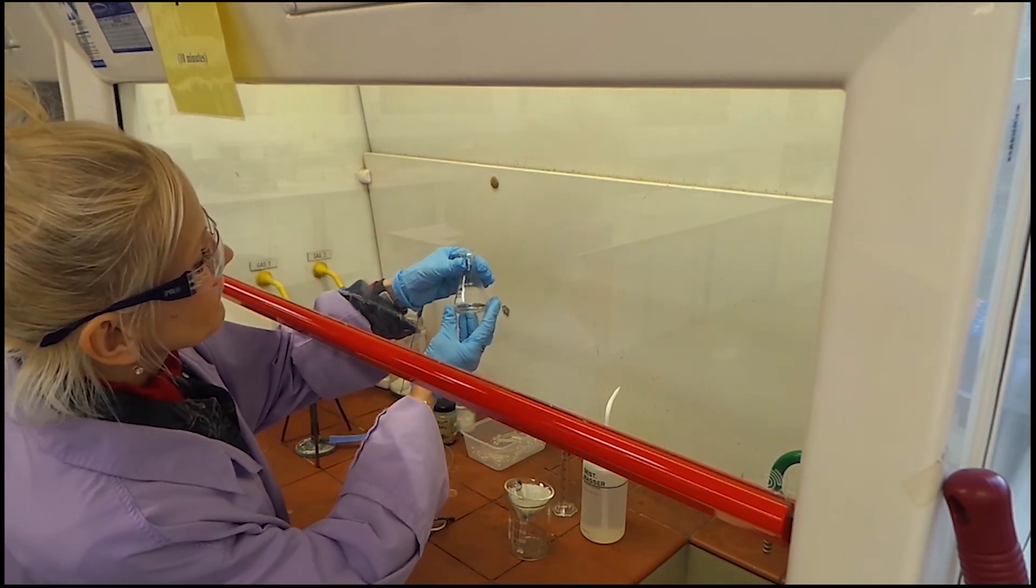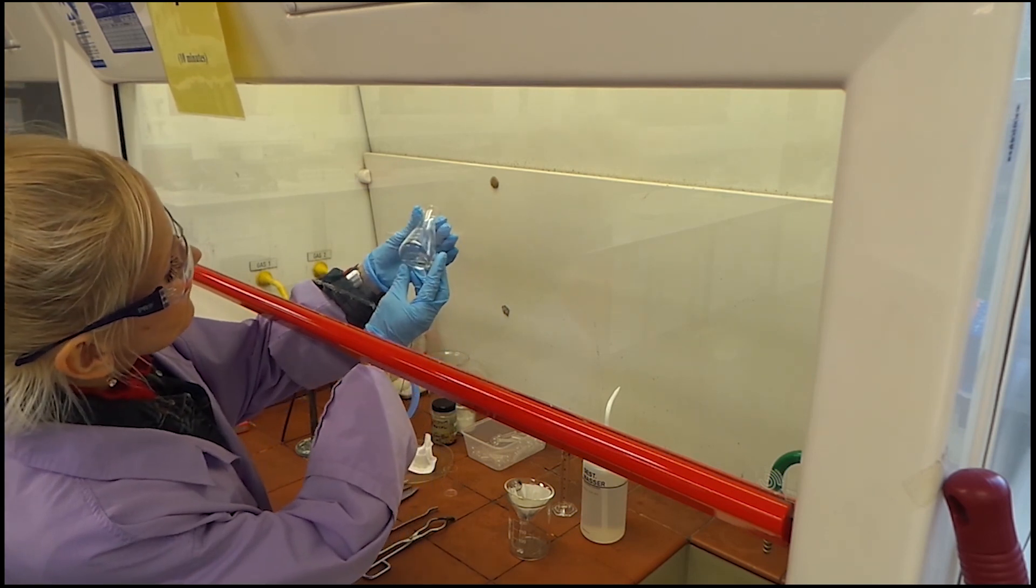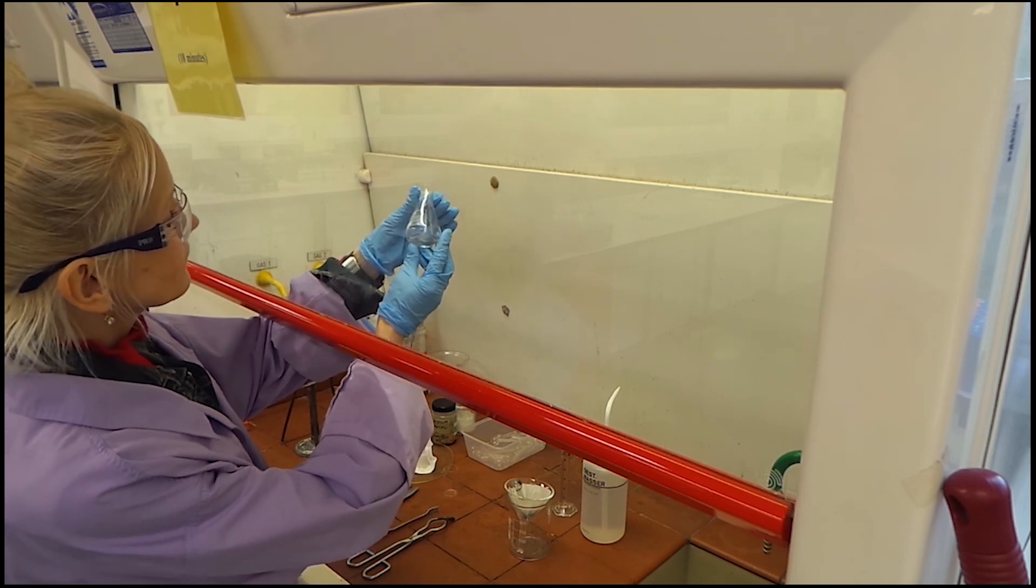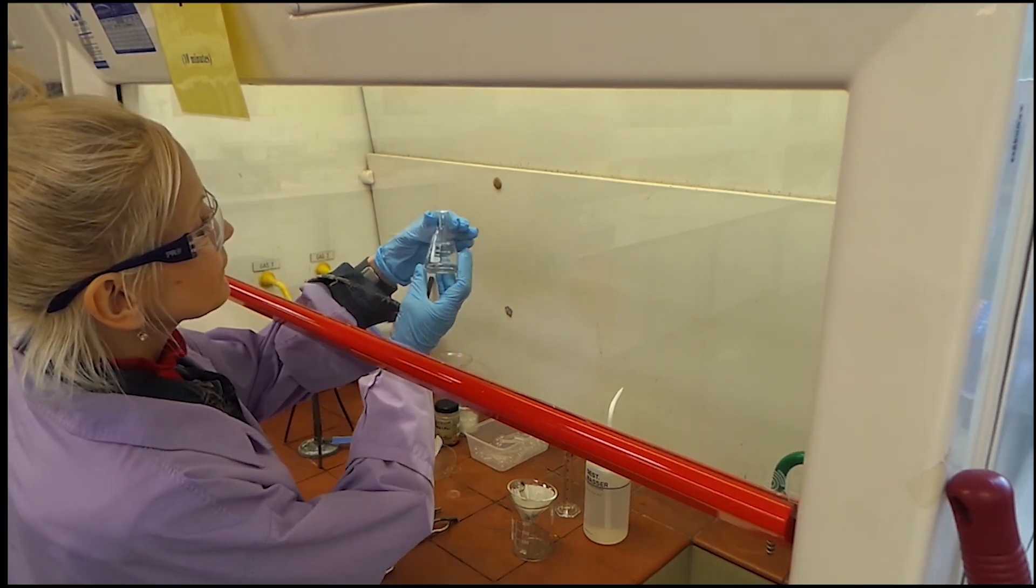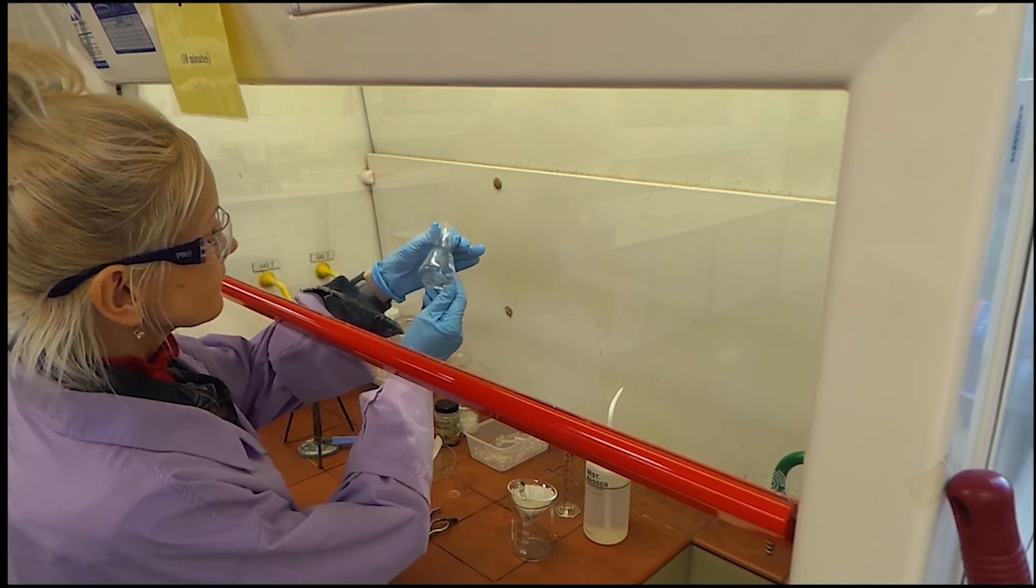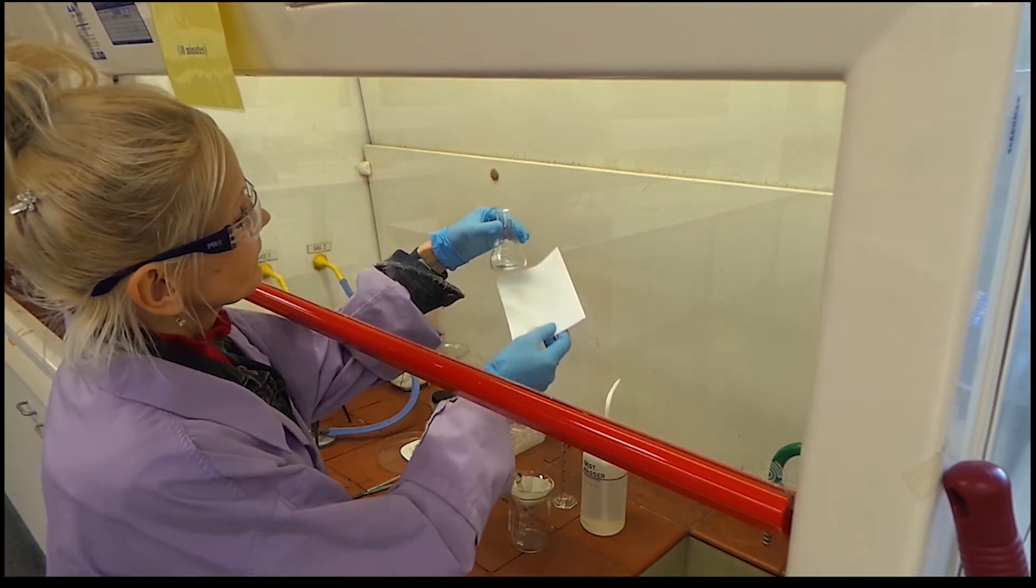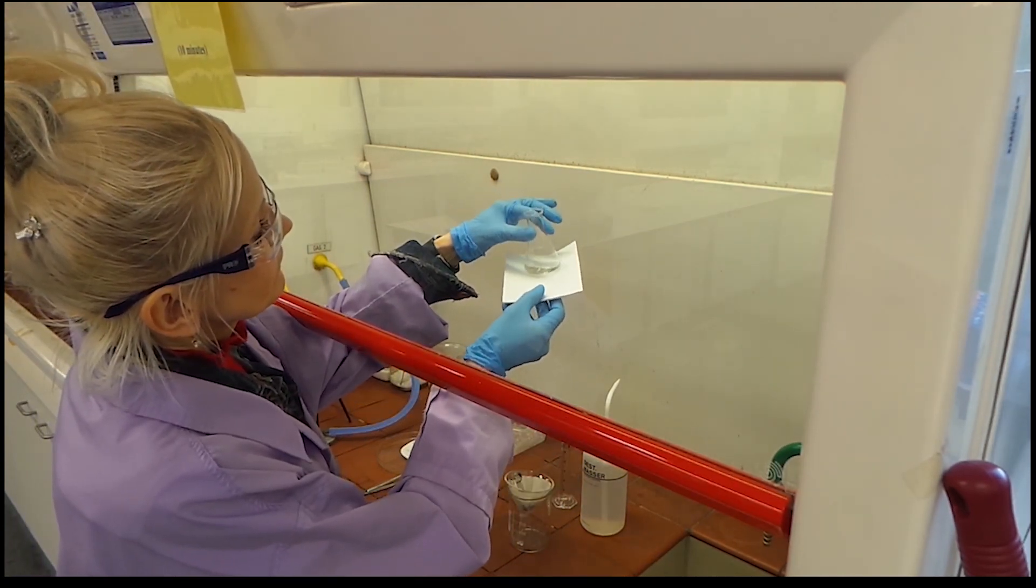We are going to take a close look at the filtrate. The filtrate should be colorless. If it is not colorless, the sodium fusion must be repeated. Only colorless solution is used for the detection of sulfur, nitrogen and halogen. Good luck!